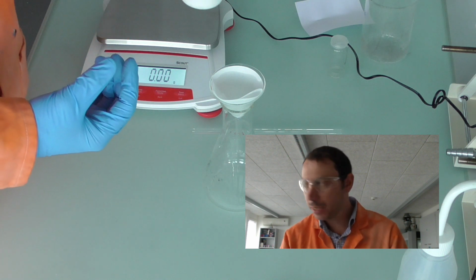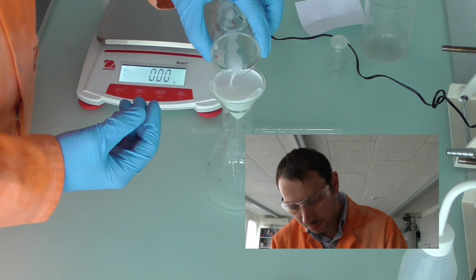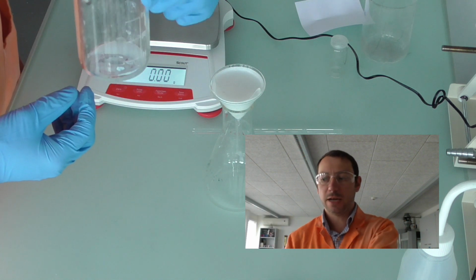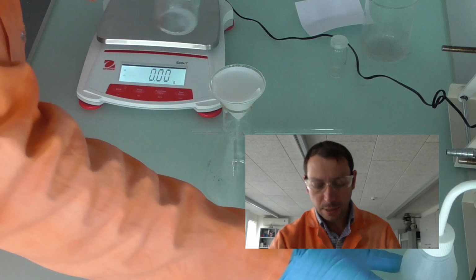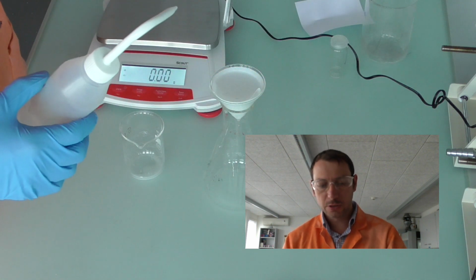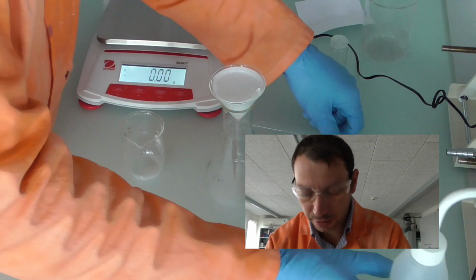So I'm going to pour it into my funnel, my filter paper, being careful not to overflow. We can see I've gone to the top there, and then I'm going to wait. However, you can see here that I still have some solid left in there. So once I get space in my filter paper, I'm going to wash all of that residue out with a small amount of distilled water. At the same time, if you've used your glass rod to help dissolve some of the solid, you would rinse that off as well, trying to make sure that we get all of that solid in there.